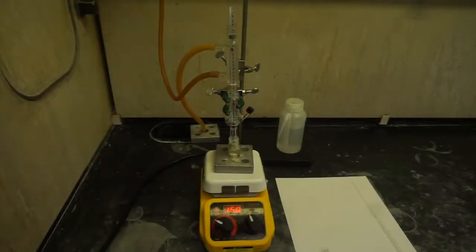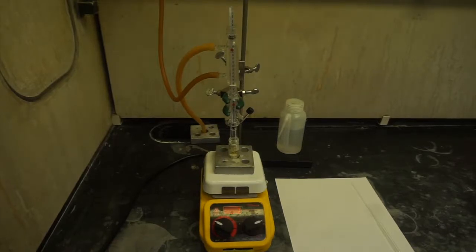Once the reaction mixture starts boiling, keep the mixture under reflux for at least 1 hour for a complete reaction.